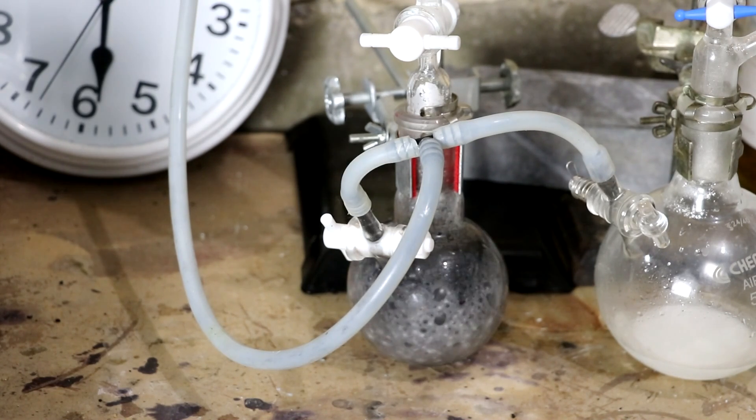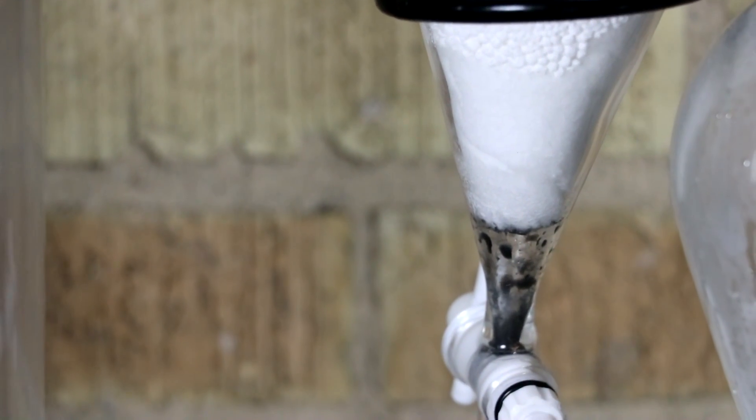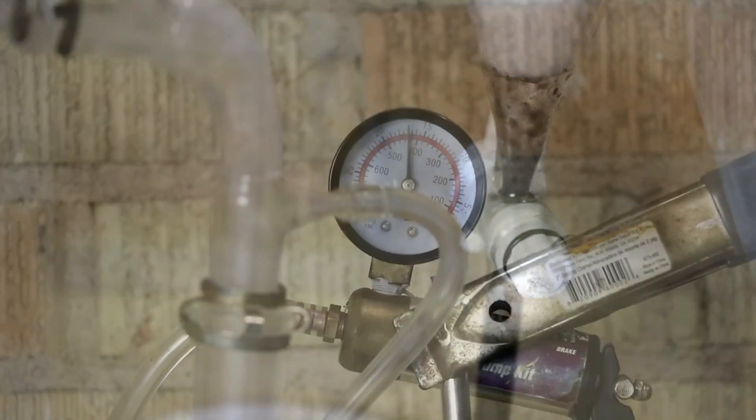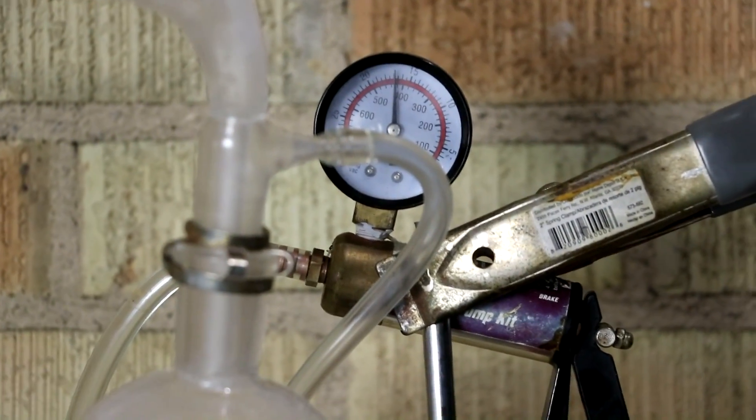Well, that's what the filter's for. Yeah, the filter's doing its job. It's keeping that manganese dioxide out of there. Okay, that's about the right amount of oxygen in.